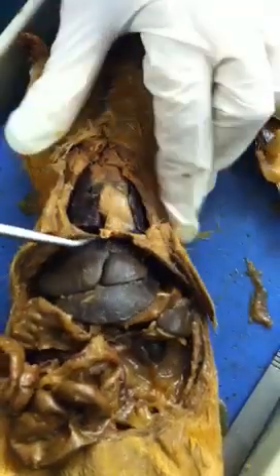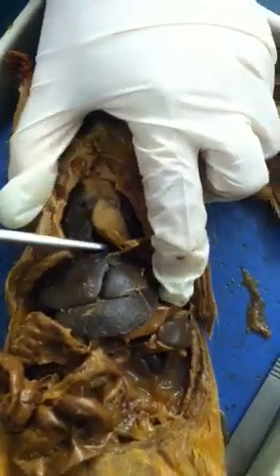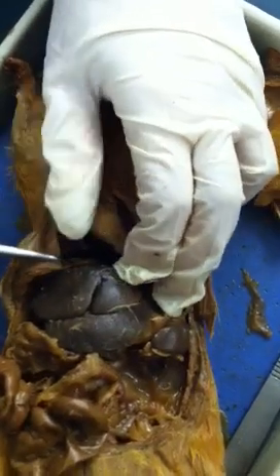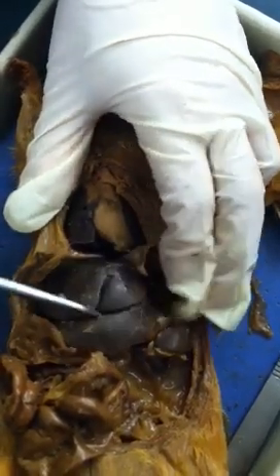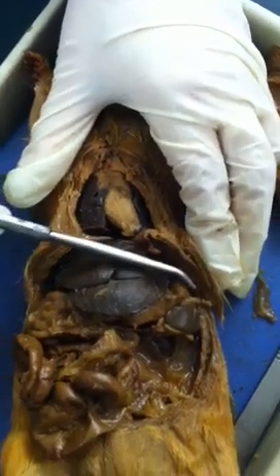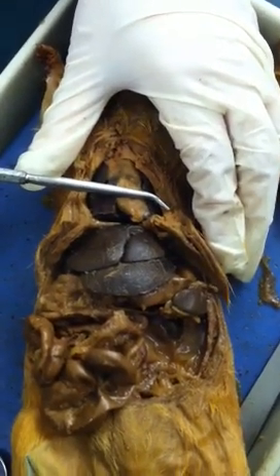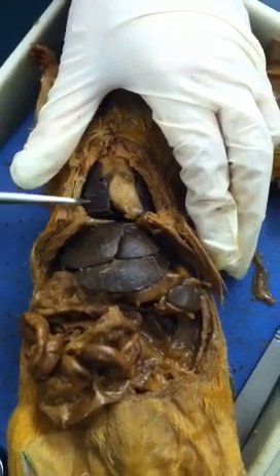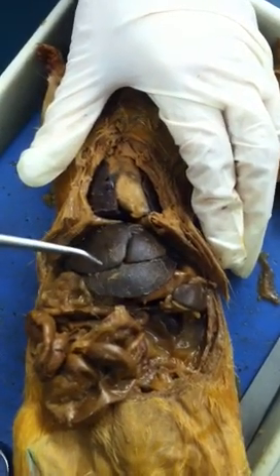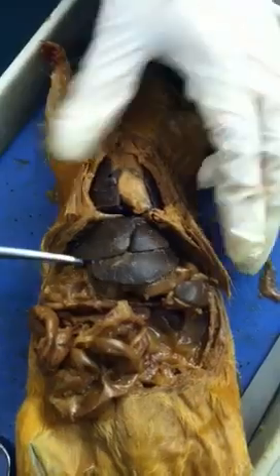And there is a tubular structure. If I open up the diaphragm, here this will be the liver. Remember, the organs right above the diaphragm are the lungs and heart. If it's right below it, that's the liver. The liver has multiple lobes.